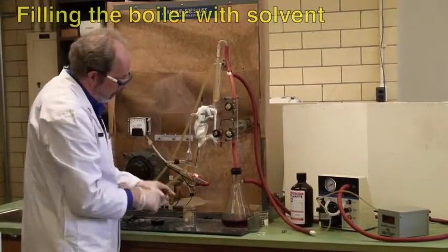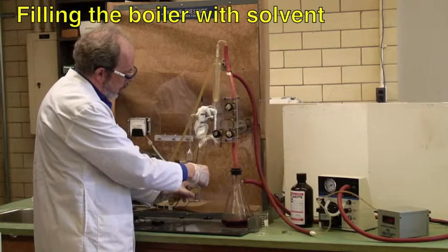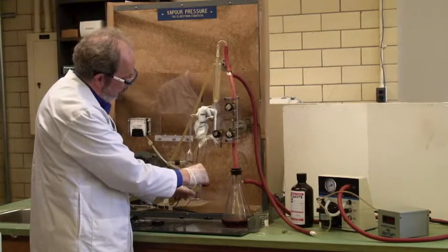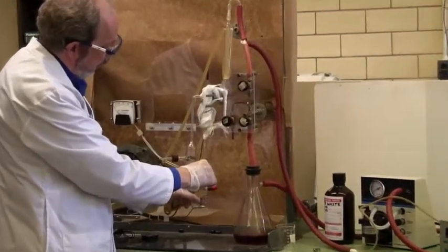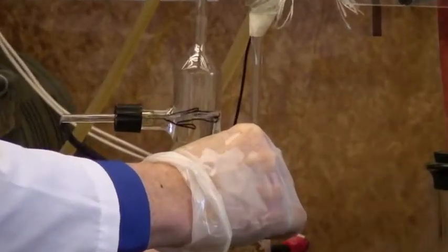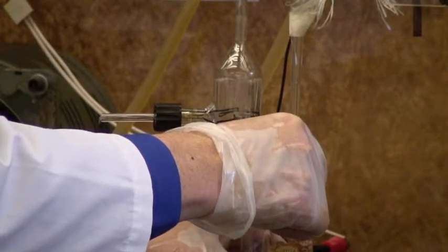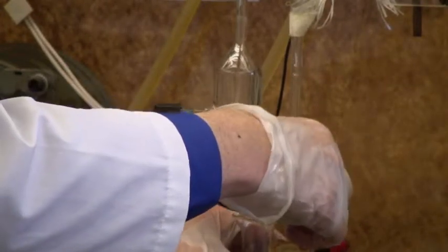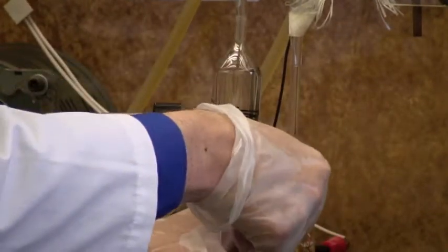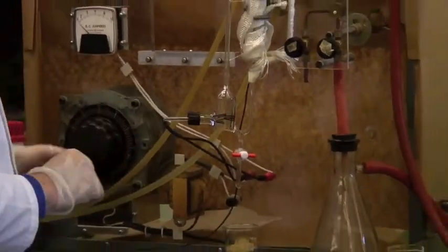The next thing I need to do is actually fill this, and you do that by suction. You put the tip of the tap inside and open the tap gently, and you'll notice it starts aspirating that liquid inside. And again, you want the liquid somewhere in the curve at the top here. Shut it off, put the liquid down underneath.